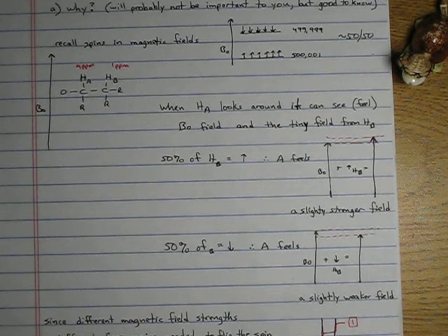Whenever you're on the instrument and you're integrating peaks, if you see, oh, these are two peaks, it's a doublet, integrate them both together so you get that one. Never integrate a half and a half. Always integrate them together. All resonances, all multiplets, you integrate as one peak, because it is one resonance. These two peaks are due to HA. One HA proton, so you need to integrate them together to get that value of 1.